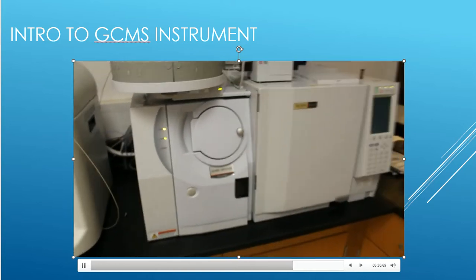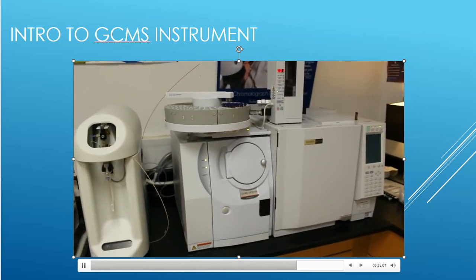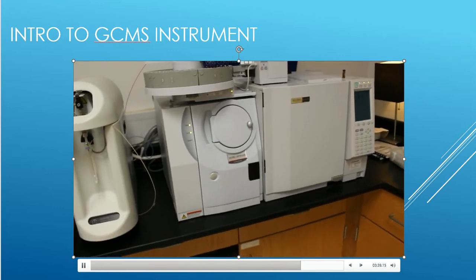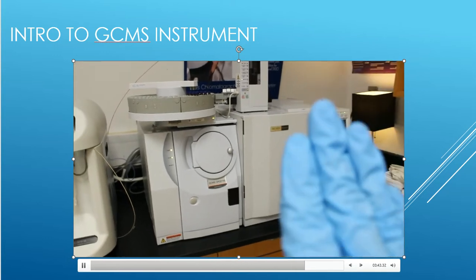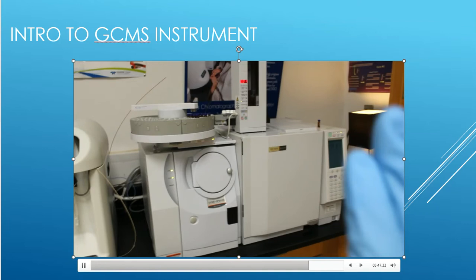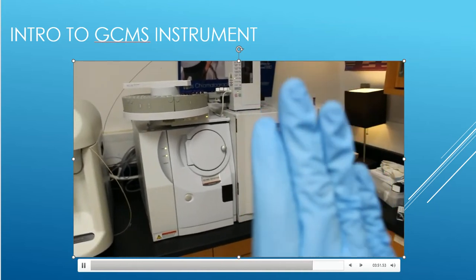So folks, that is our GCMS system that we're using for this particular laboratory. The mass spec is what we're going to focus on, not necessarily the GC part, which is here. That's only doing separation. That's for a different course, for our chemical technology program. That is not necessarily for what we need to do today.